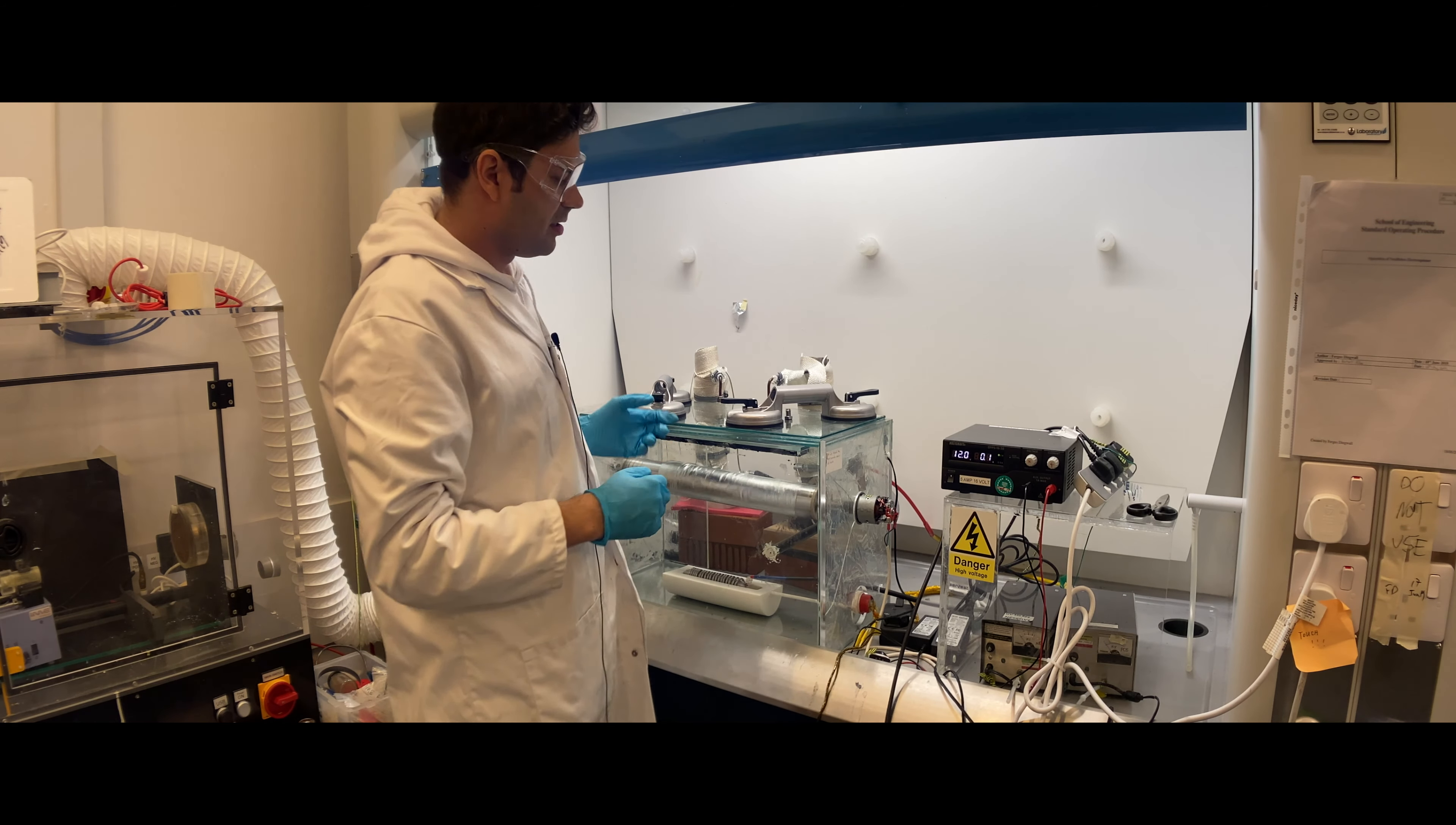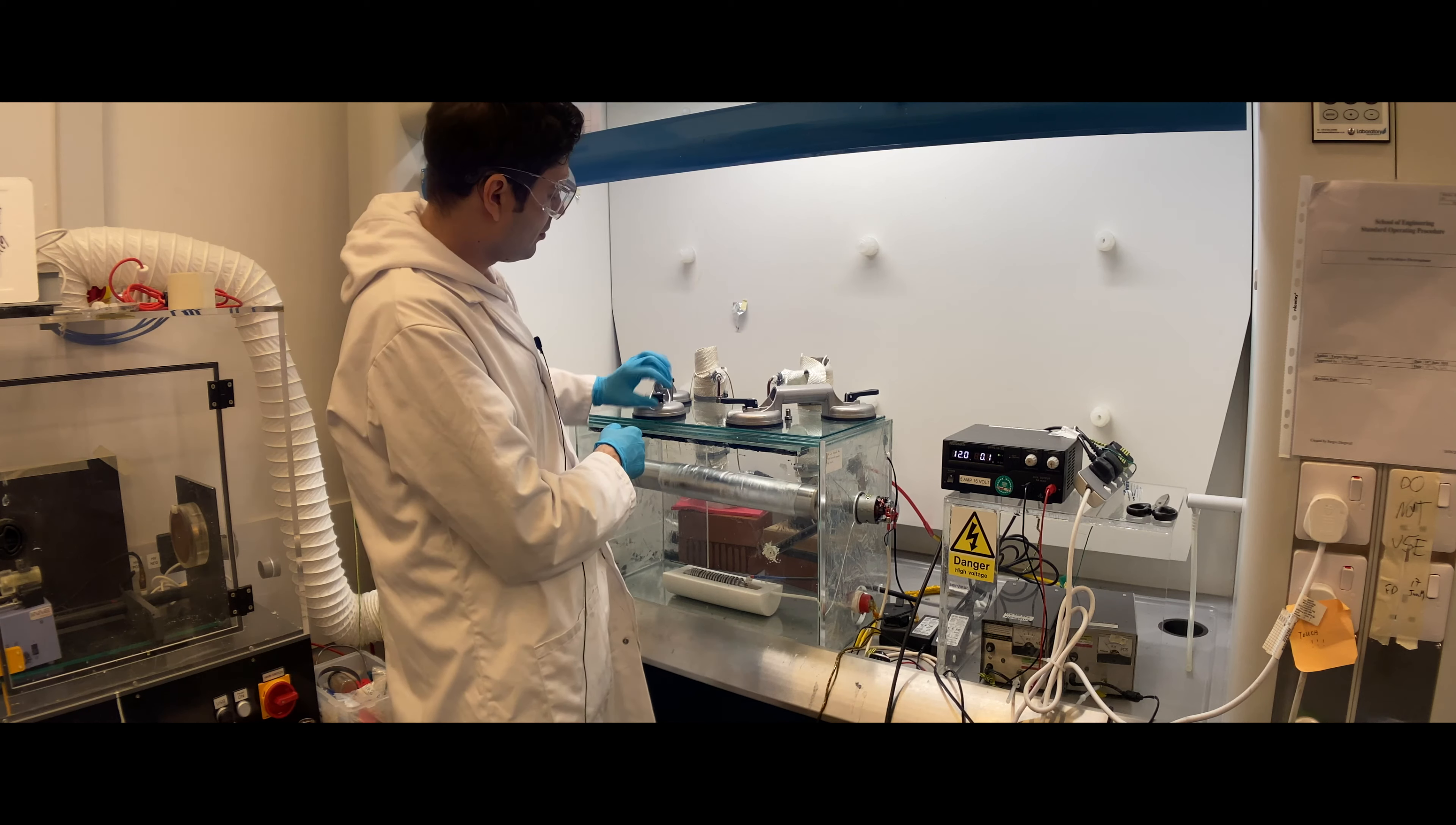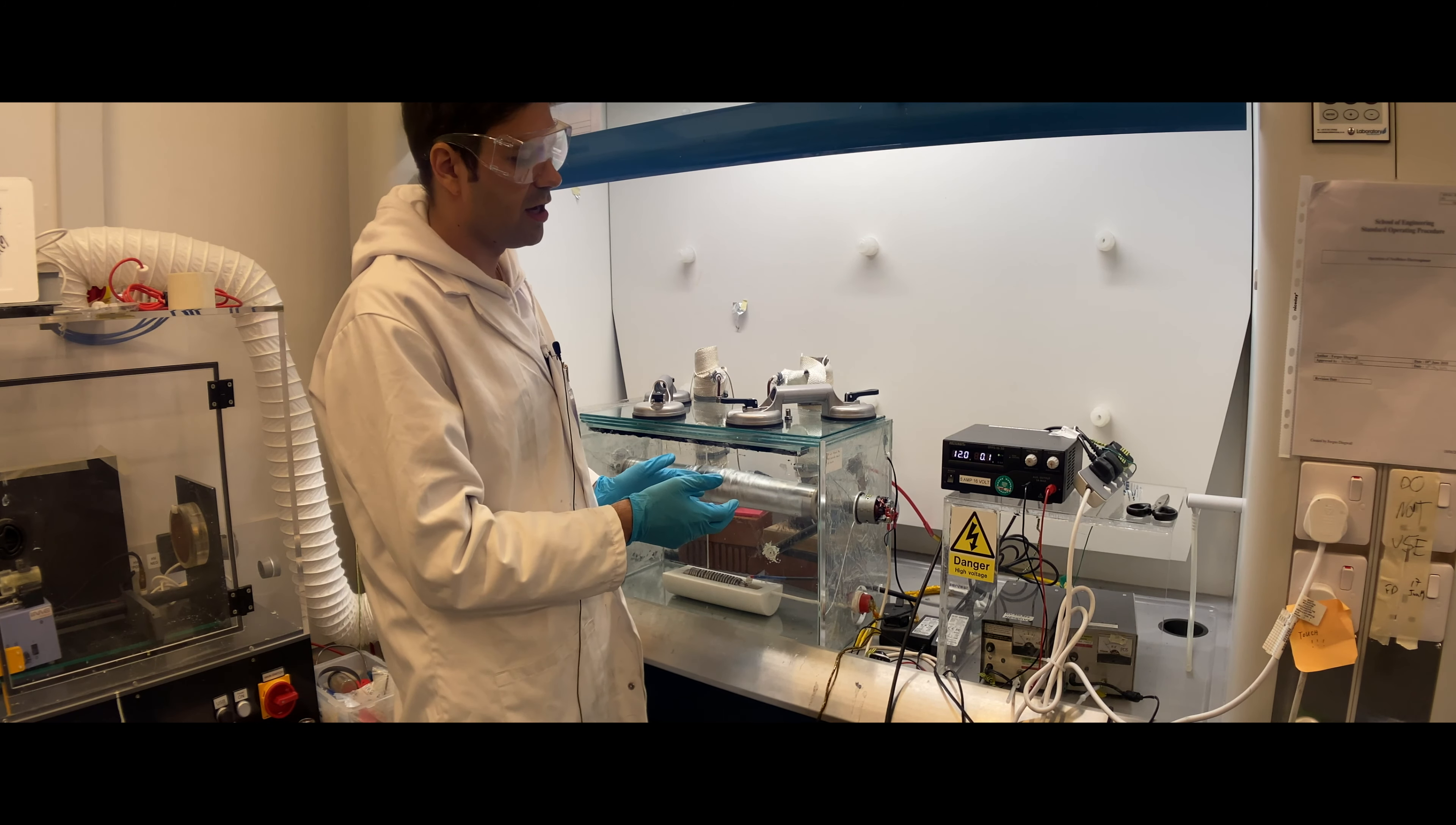If you need to use hot air or just normal airflow, you can connect these switch lock connections to this. You can also remove these if they're in the way simply by turning this up. You can remove these suction handles. Now the setup is in principle ready for operation, and we can turn on the high voltage.